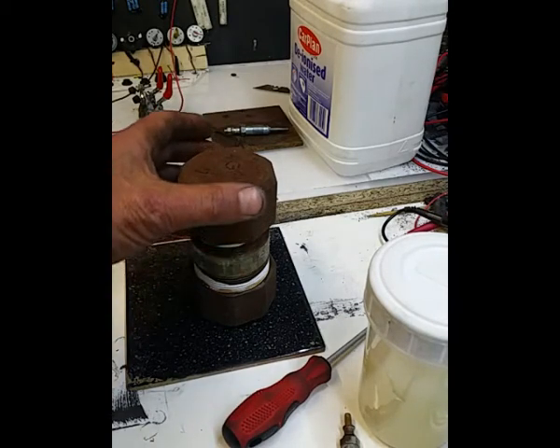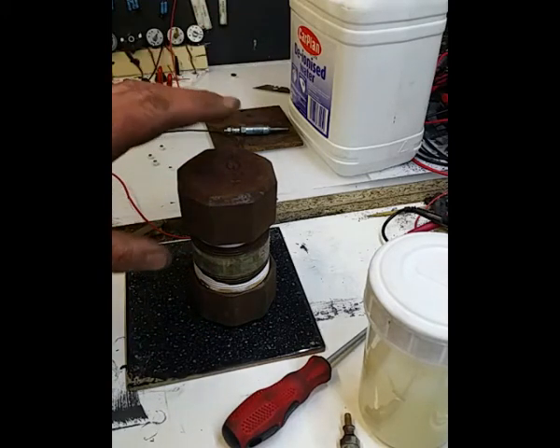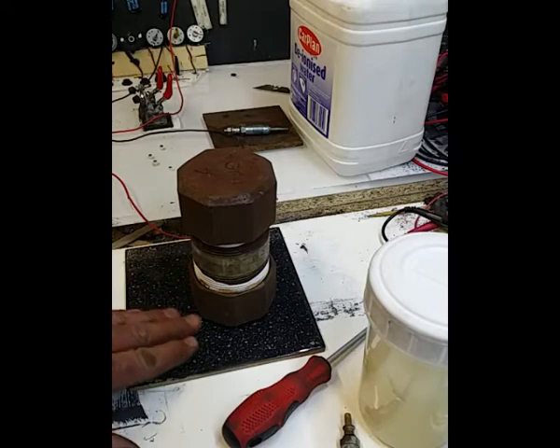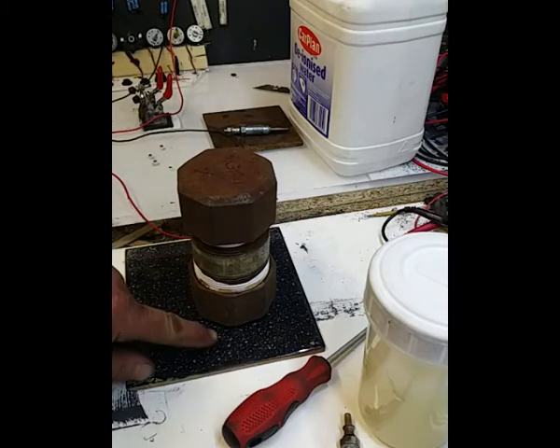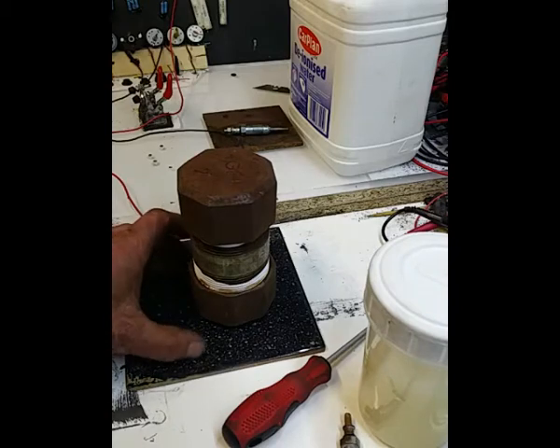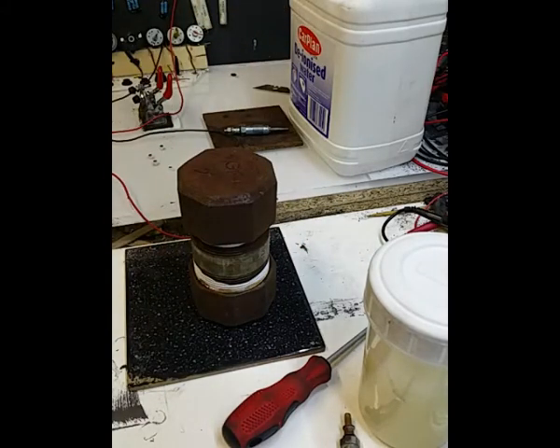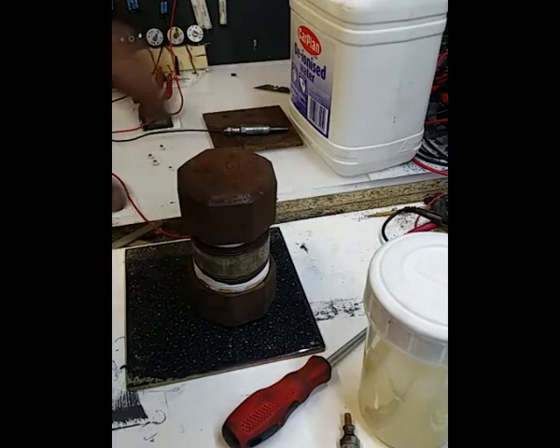We've got no even heat distribution. Heat rises, so that's going to be hotter. We know that bit. We've got thermal runaway on the tile. The tile is quite warm, so I'm guessing what we really need for this to work properly is a thermal barrier on the base, so we don't get that runaway, and possibly a thermal jacket of some sort around it. I don't know, there's lots and lots of things you could use for that. Maybe a little bit of rock wool or something like that. So I'm going to stop touching that because it is hot.